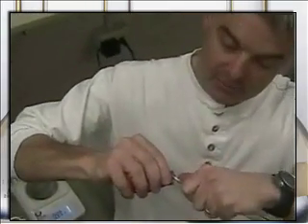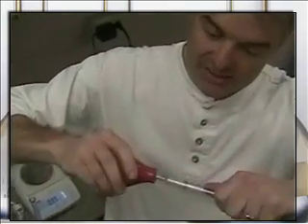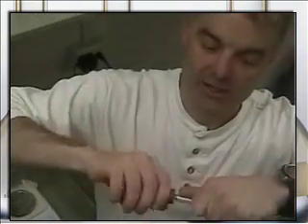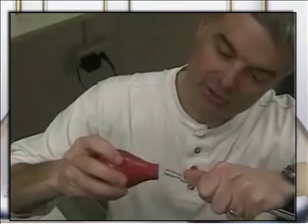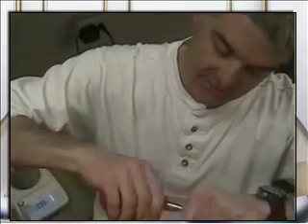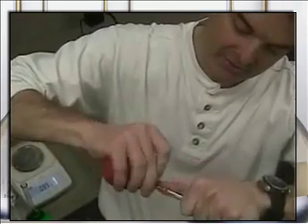So I put the bulb on here. Now one of the mistakes I see students do is they take this bulb and they jam it down on top. That's incorrect. What you really want to do is barely put the bulb onto it, and I just jammed it on there. I want to just barely get it on there, okay?